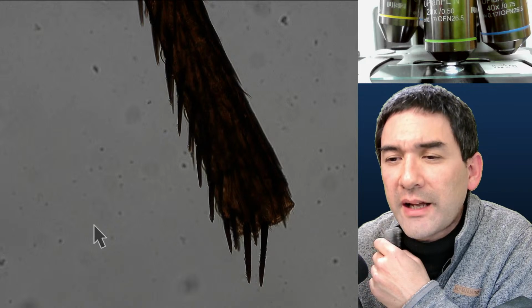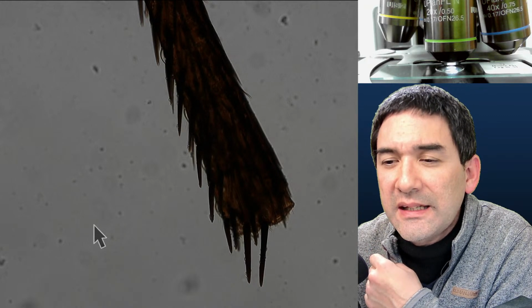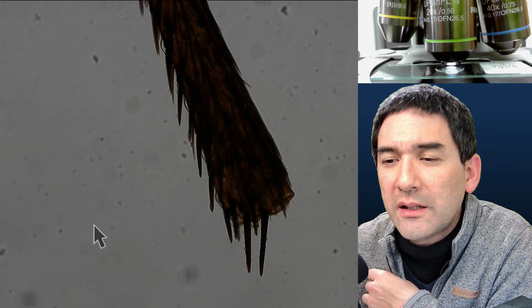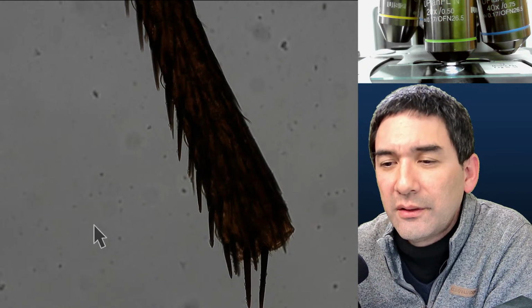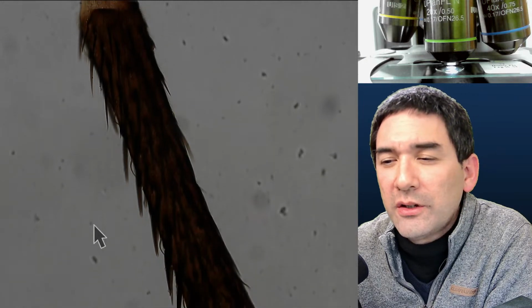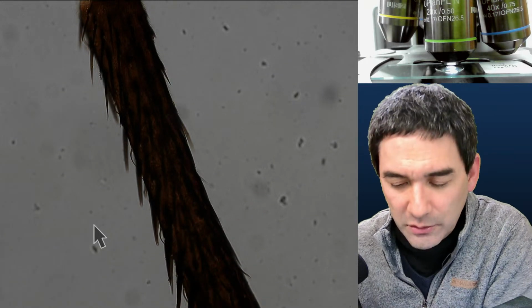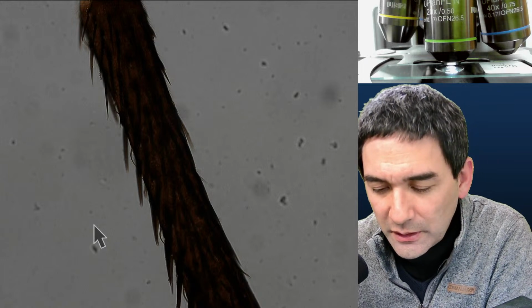The advertising of diatomaceous earth says it damages the exoskeleton and the insect dries out. That's interesting, I didn't know that. I should zoom in on the mosquito proboscis. I don't know where it is now, unfortunately.